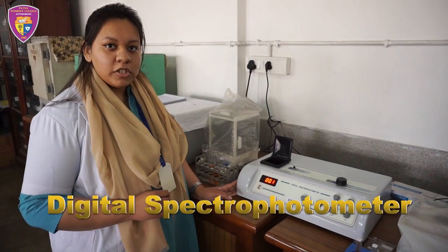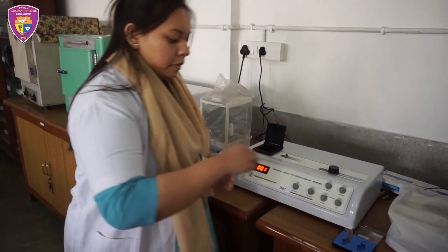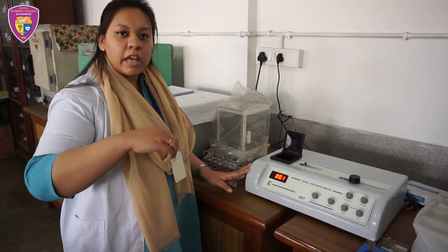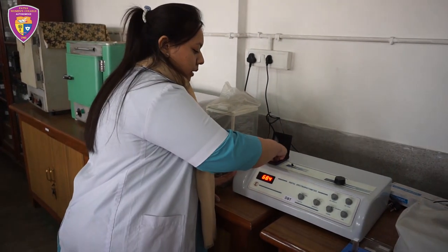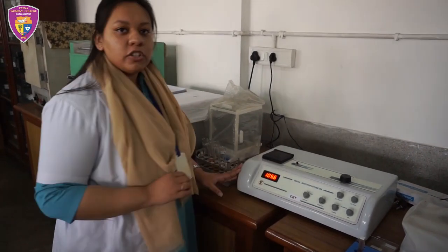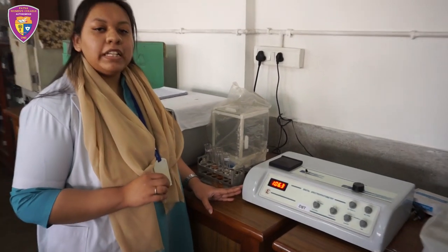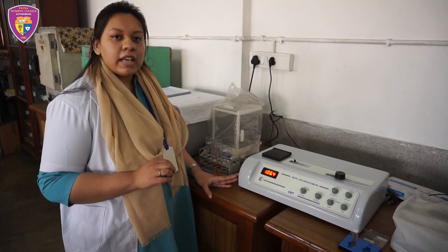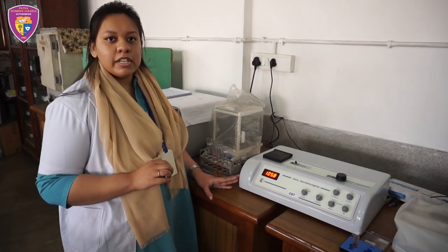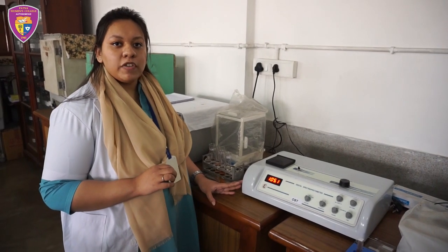This is a single beam digital spectrophotometer. It tells us the absorbance of light by a sample solution. For measuring the sample solution we place a blank in the cuvette holder. It works on the principle of Beer-Lambert's law, by which we establish a linear relationship between concentration and absorbance of a sample solution. The uses are for quantitative and qualitative estimation of DNA, RNA and proteins, and for checking the purity of a sample solution.